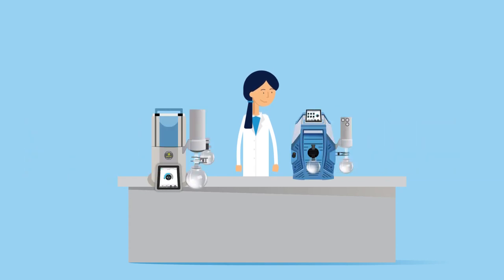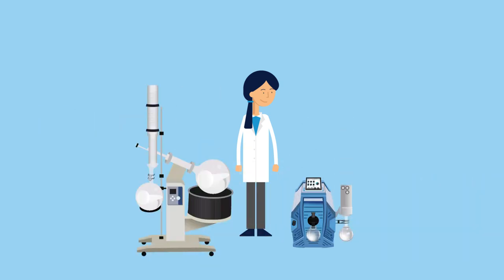The range and models available in this series will ensure that Linda always has the right equipment for her needs. When Linda needs to scale up her rotary evaporations, she can move to a larger model in the series without sacrificing any of the quality she expects from Vacuubrand.